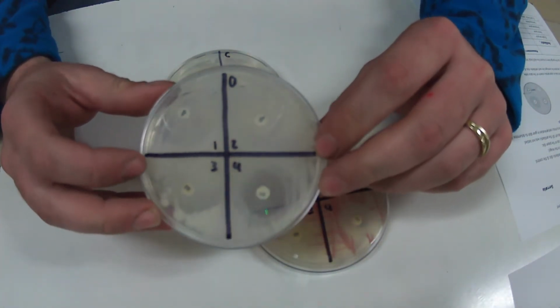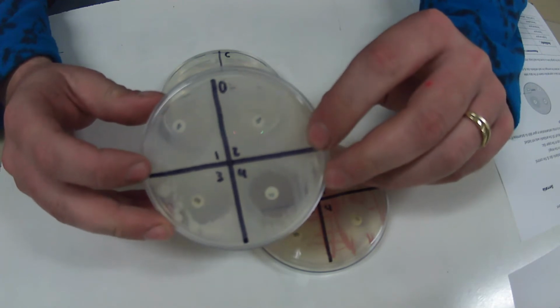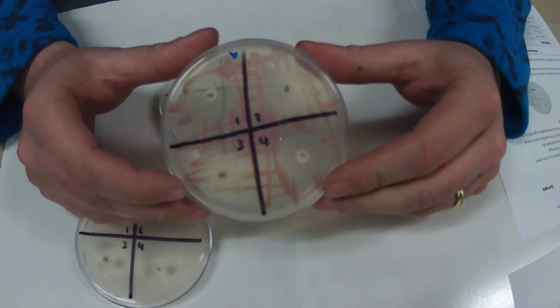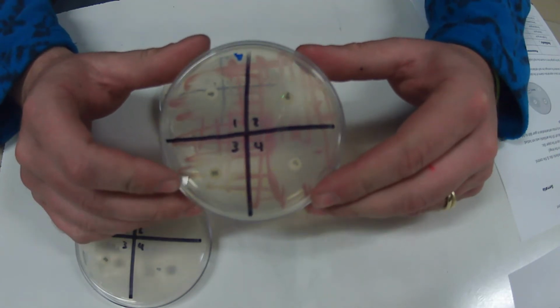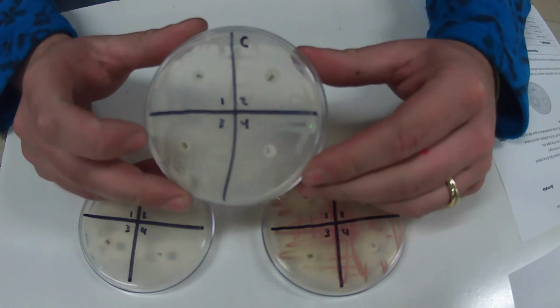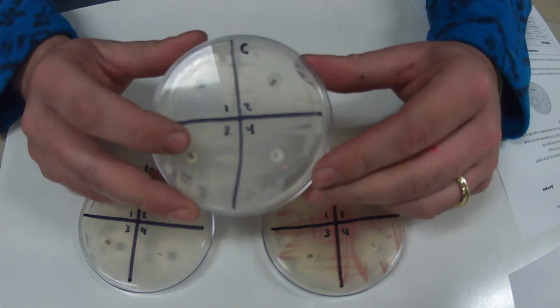These ones, guys, have white bacteria or almost a cream-colored bacteria that you can see. Serratia, on the other hand, has a red bacteria, which makes it a lot more apparent and a lot easier for you guys to see on this white background. And then C looks something like this, also with a white background.